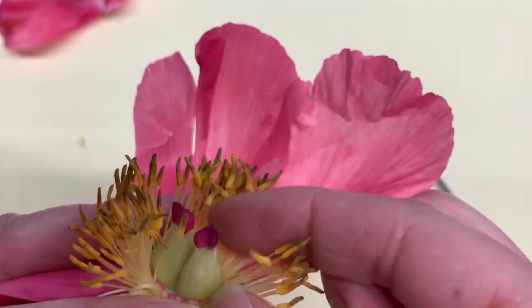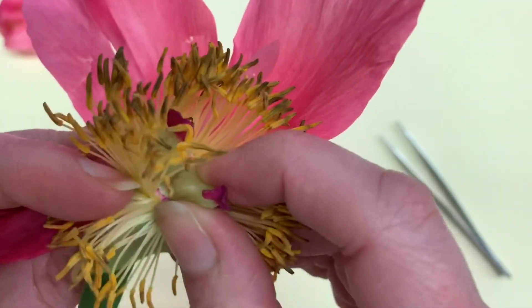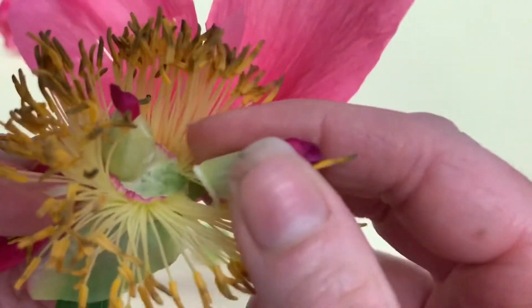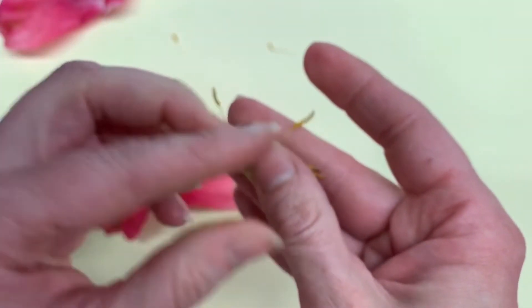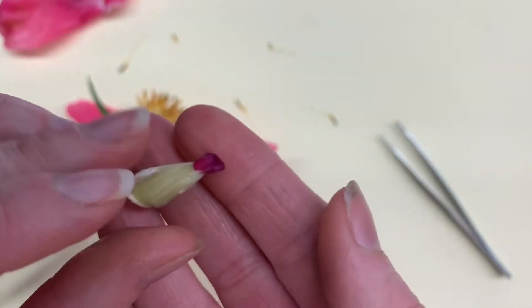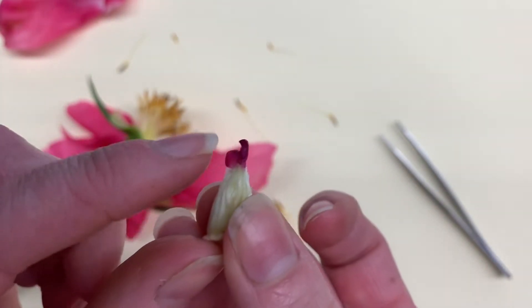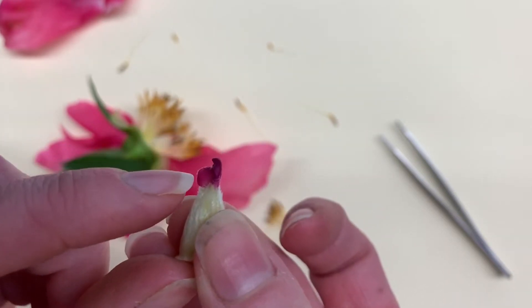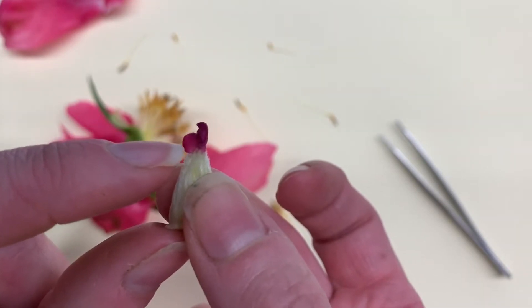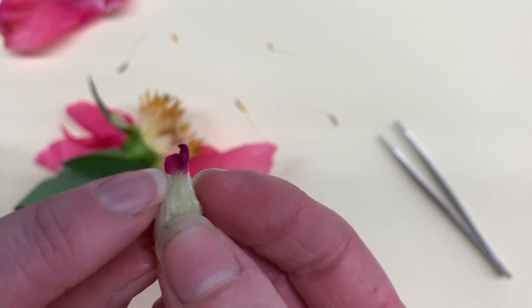I'm going to carefully remove one of the pistils. This is our pistil here. This top portion is sticky — we say that's the sticky stigma — and the pollen lands on the stigma. Then the sperm will travel down through the style, which is right here.